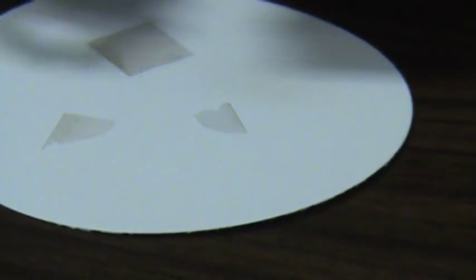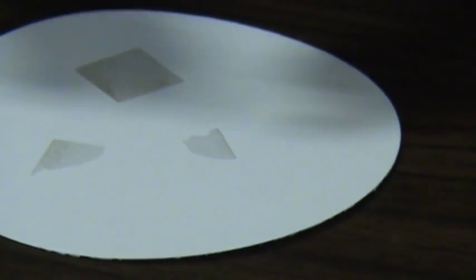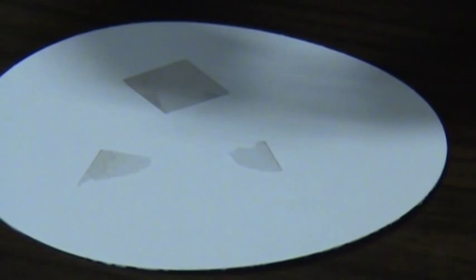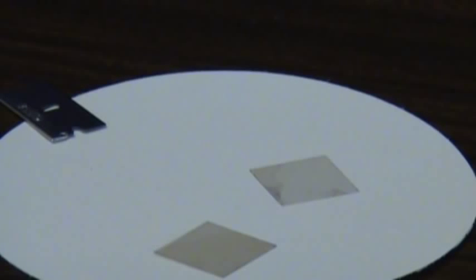The freshly cleaved surface is now available for use. As always, be sure to wear safety eyewear while performing this process and safely dispose of all used razor blades.